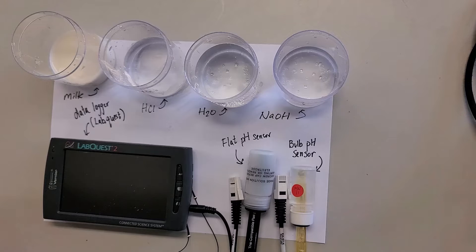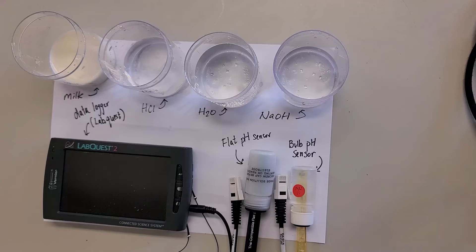Let me introduce you to the equipment first. This is the data logger. If you cannot install the data logger software in the PC or you don't want to leave your PC in the lab for a long period of time, then you can use the data logger. Just one thing - it's best that you charge it while you use it, so then the next person can use it without the charger. That's why I plug it in.